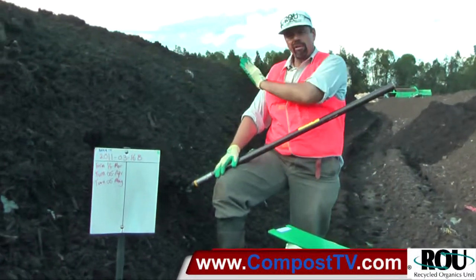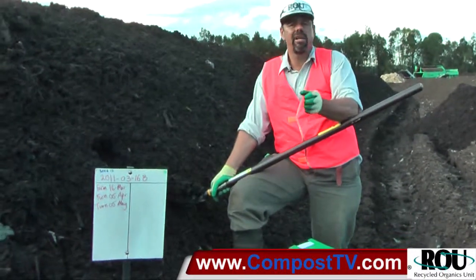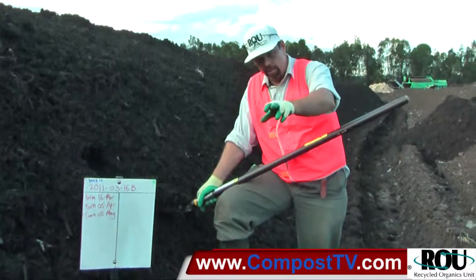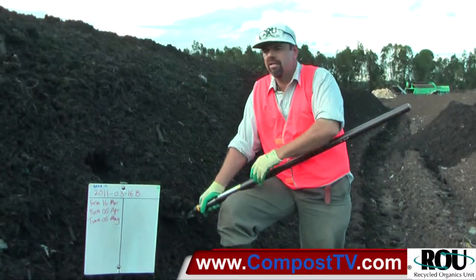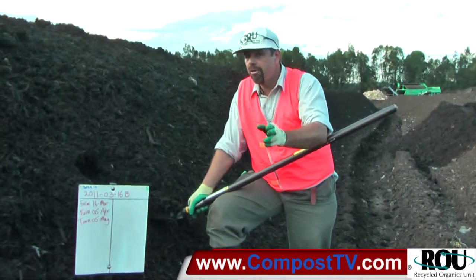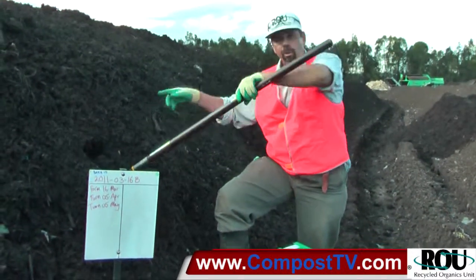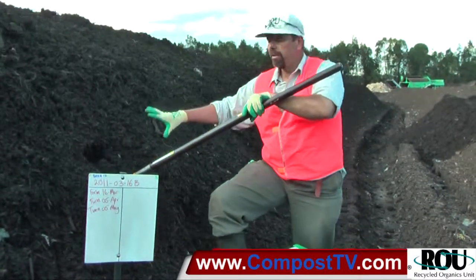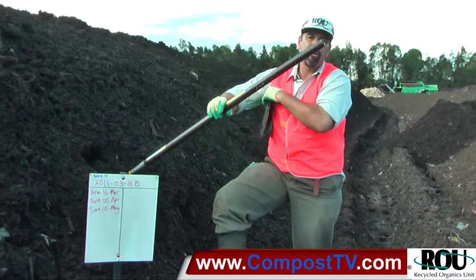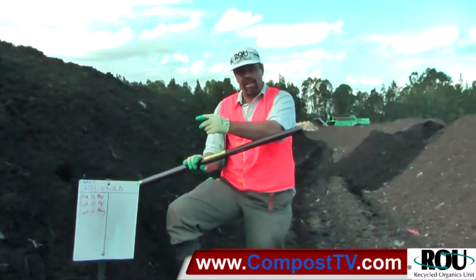So effectively along this windrow, we've got something in the order of 600 cubic metres. The standard — adapted from the British and European standard — tells us that for a 600 cubic metre windrow, we need a minimum of 13 incremental samples. That means 13 sampling points where we're extracting a sample of adequate size and putting that into our clean buckets to take back to mix up into a composite sample that can then be assessed.